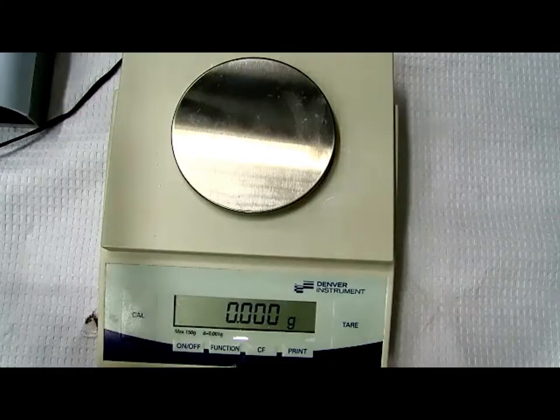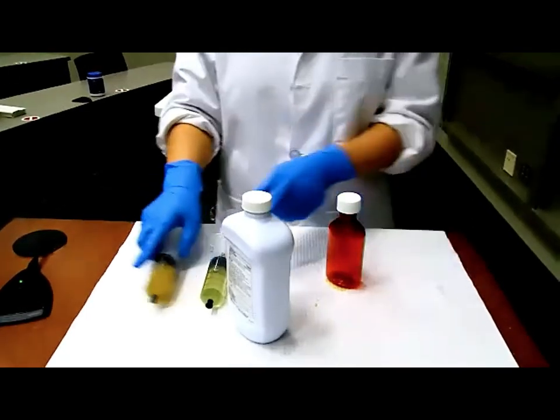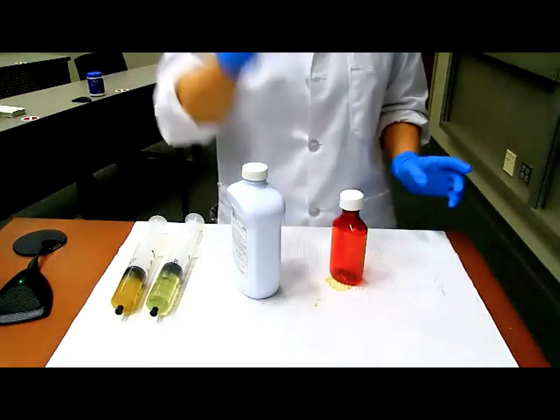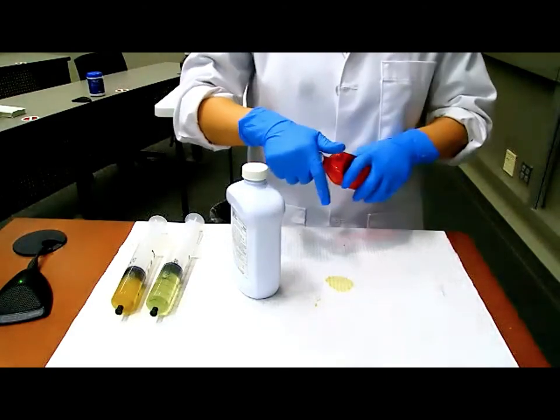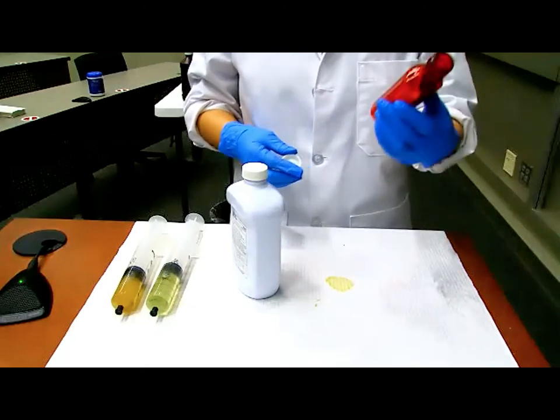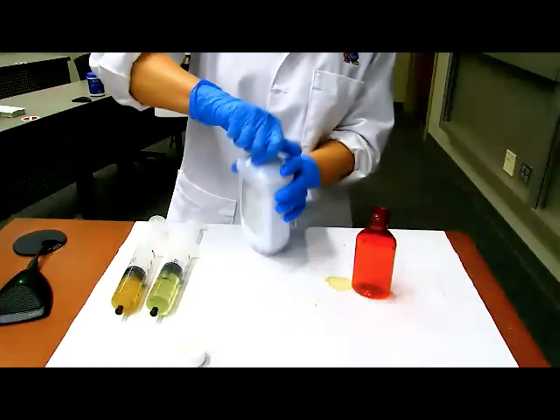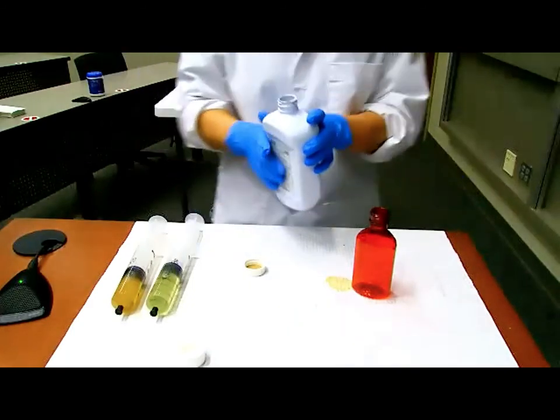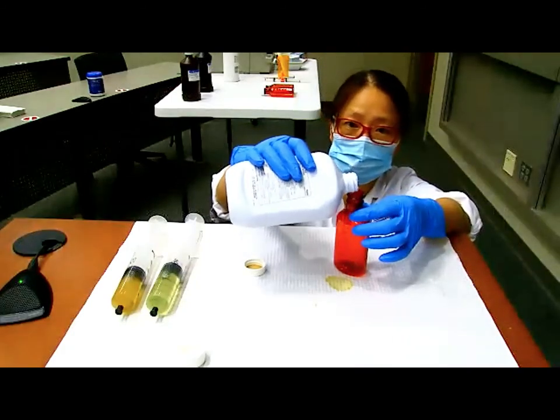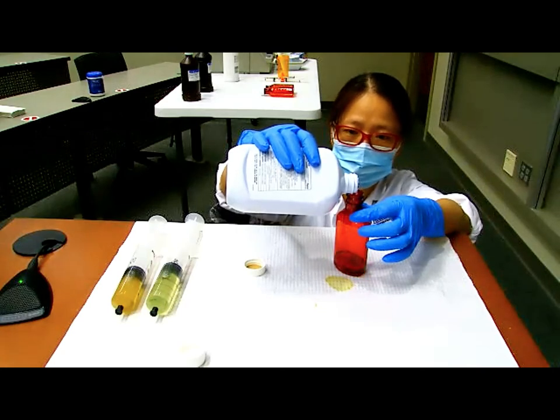All right, I think we got everything up and ready to go. Okay, all right, so I have everything here that we need. We will start with mineral oil. Before we start, I want to say that this is probably one of my favorite dosage forms because I don't even need any equipment. The only equipment I need is the bottle itself. All right, so we will transfer 30 mL of mineral oil directly into the bottle. And watch me, I am going to bend down because I want to make sure that I can measure accurately.